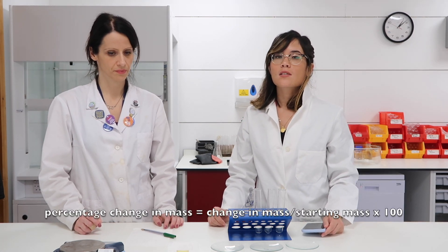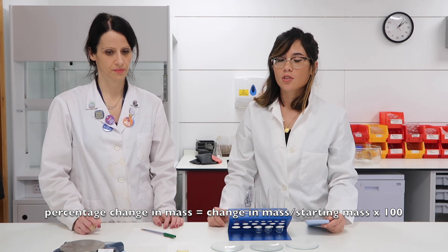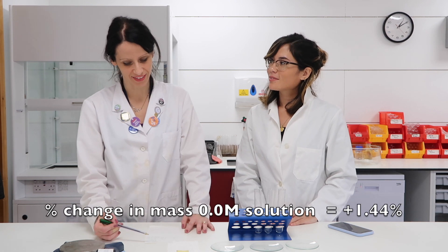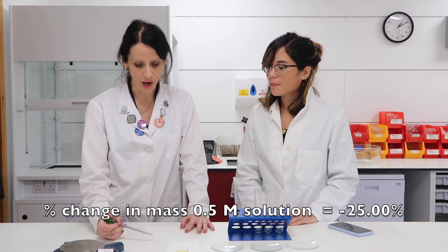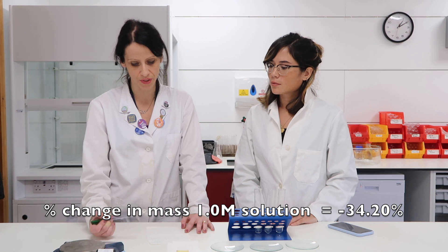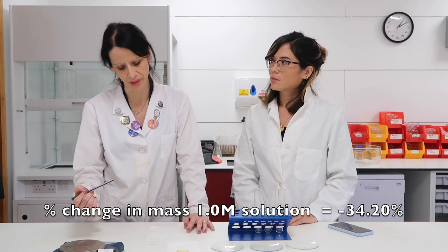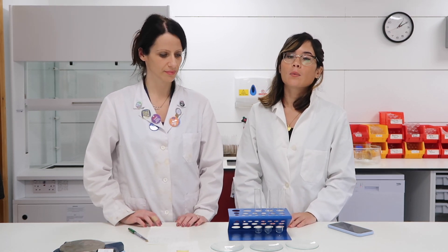To calculate the percentage change in mass, simply do change in mass divided by the original mass, then times by 100. The first chip gained 1.4% in mass. The second one lost 25% of its mass. And the third one lost 34.2% of its mass. That's exactly what we would have expected. You can draw a graph showing these results, which will actually help you work out the exact molarity or concentration of salt in the potato chip — so it's a really useful experiment to do.